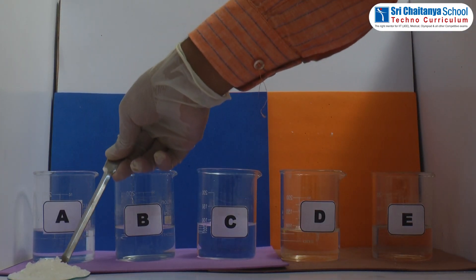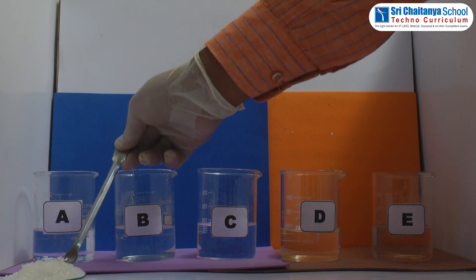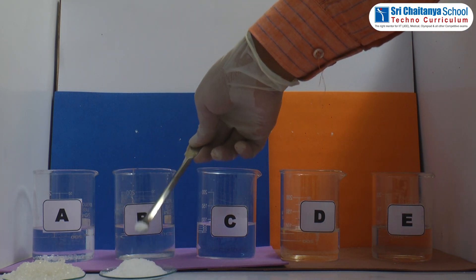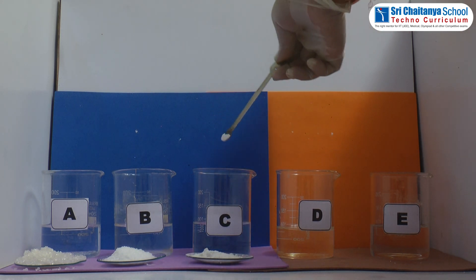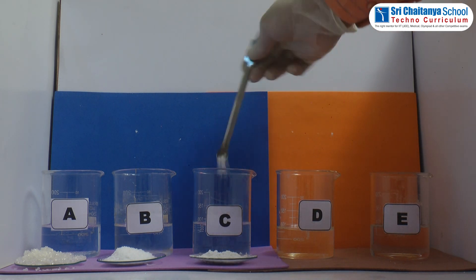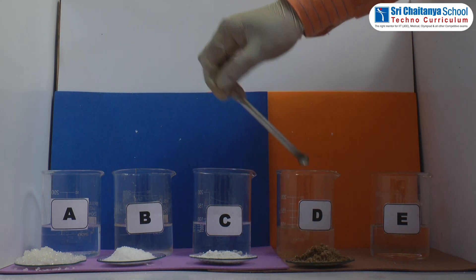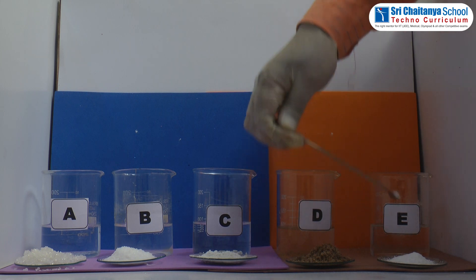Add a small amount of sugar to beaker A with the help of a spatula. Add salt to beaker B, chalk powder to beaker C, sand to beaker D, and washing soda to beaker E.